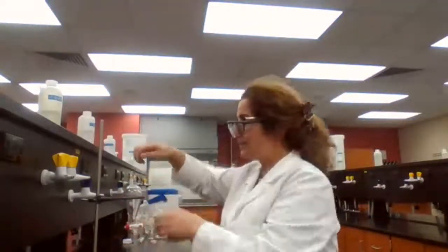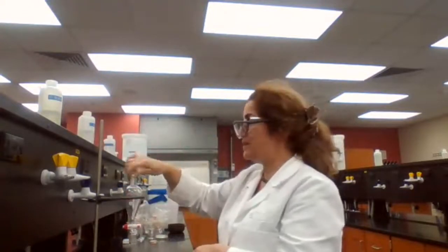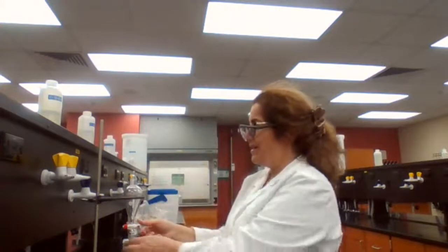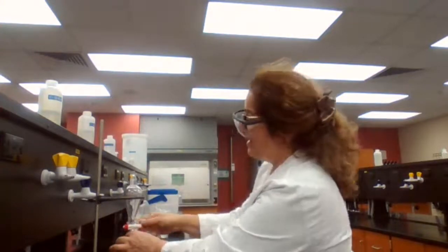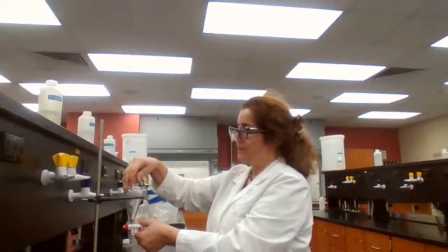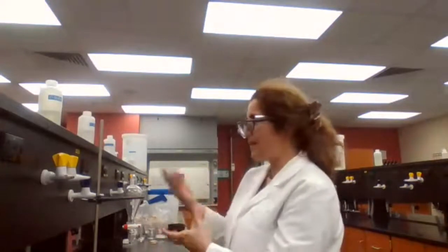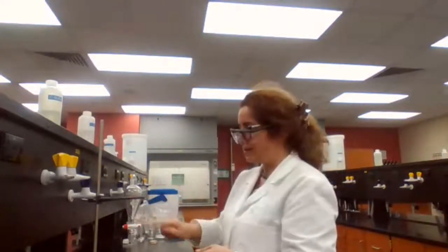To separate, the glass stopper must be out. If the glass stopper is on and I forget it, when I open this stopcock, it is going to create a vacuum because the top is closed, and it is not going to drain, or it's going to be like choking. When it's choking, it's pulling air from the bottom, and you don't want to destroy that equilibrium or the levels that are formed, because you want to see that line of separation. So that might be disturbed and is not easy to get out.